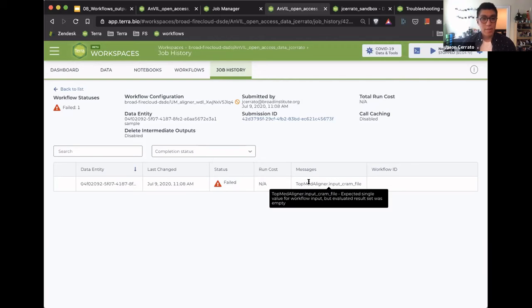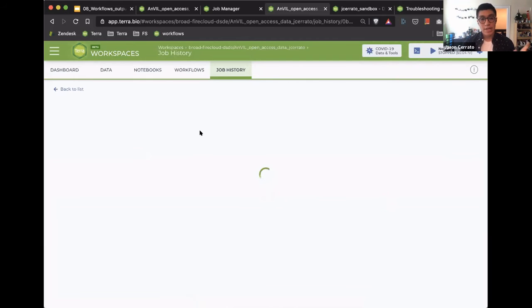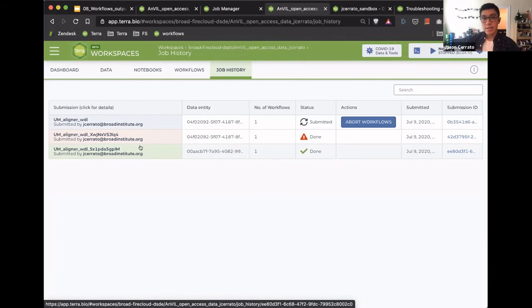And so what happened in this job was that I mistyped the attribute, and the input cram file variable couldn't read it because I didn't type it correctly. And I fixed it in this next job, and so it ran successfully. And I can quickly show you what it looks like when it fails as well. I'll post a screenshot in the Slack channel later on so that people can see the difference between the successful and the failed run and how I configured the method configuration.